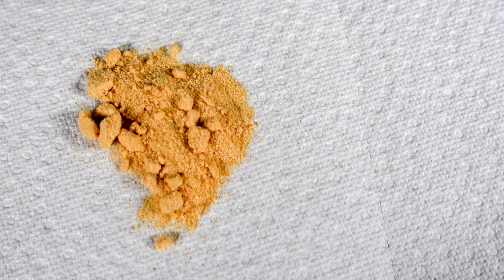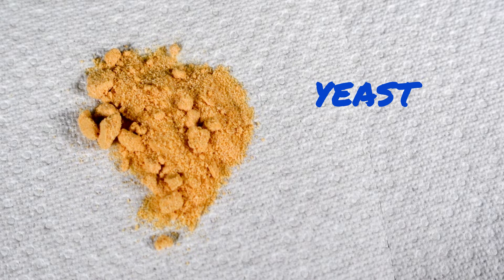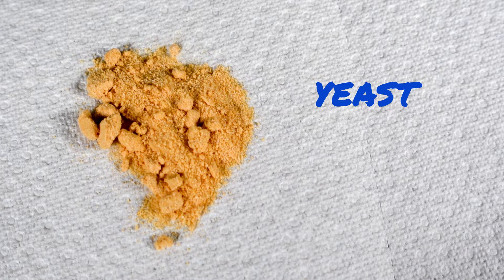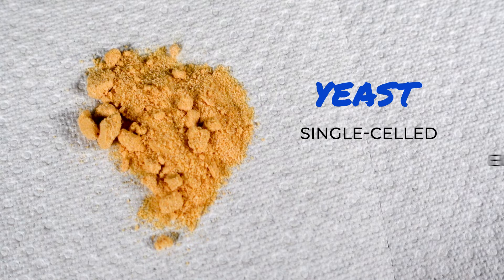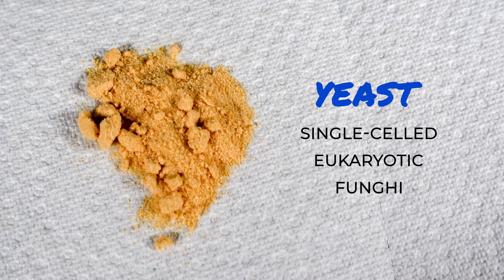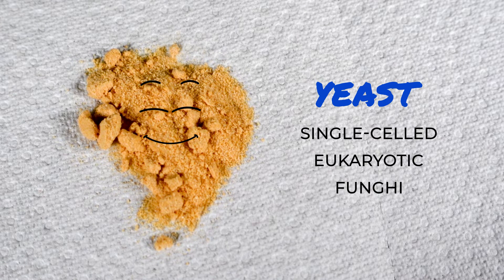The specific decomposer we will be using in this lab is called yeast. Looking at the yeast on this paper towel, it doesn't look that much alive — it's very dry and powdery. However, it is a single-celled eukaryotic fungi. It looks dead because it's actually dormant, sleeping, like a volcano that hasn't erupted in a while.